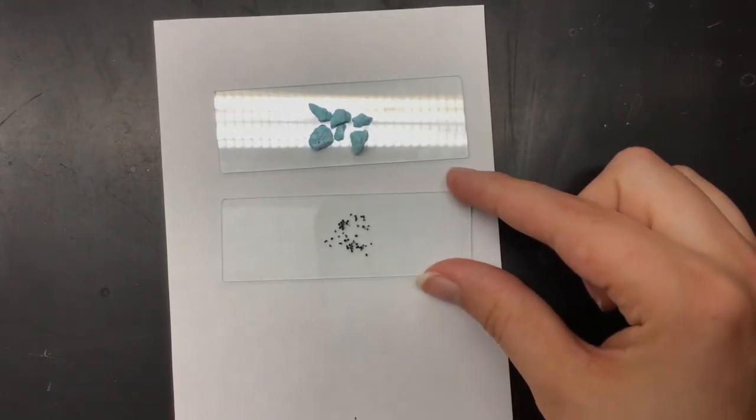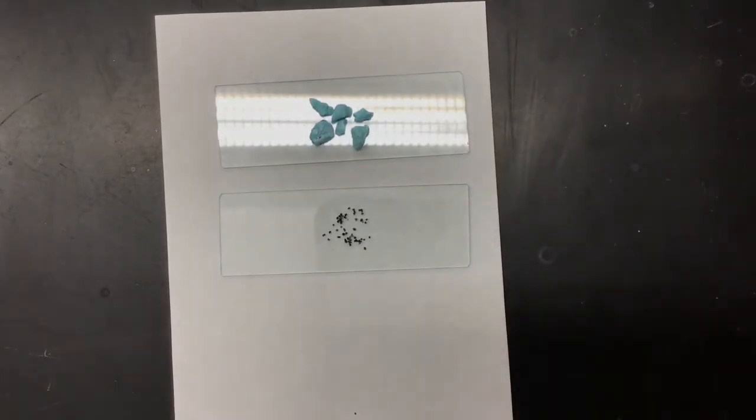They are small. They do have a grainy texture, similar to sand. So I hope that helps with that texture. The next one we're going to do is our nickel 2 sulfate.